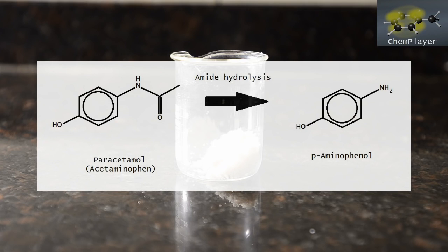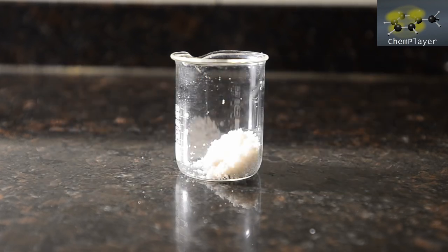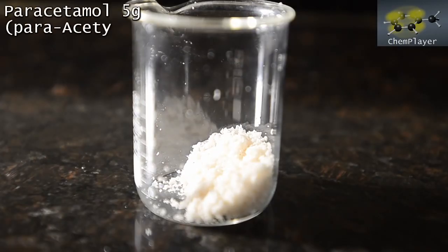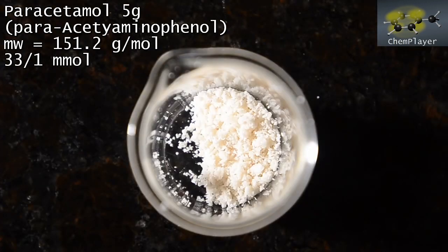Hydrolysis can be done under either basic or acid conditions, but first of all let's try using the alkali process. Here we've got 5 grams of paracetamol which we previously extracted from analgesic tablets and recrystallized. It's been in storage for a little while and it's got a very faint pink color, but it should still be quite pure.